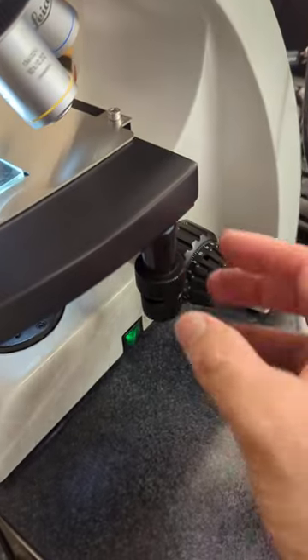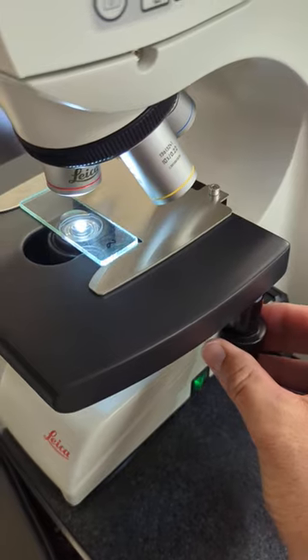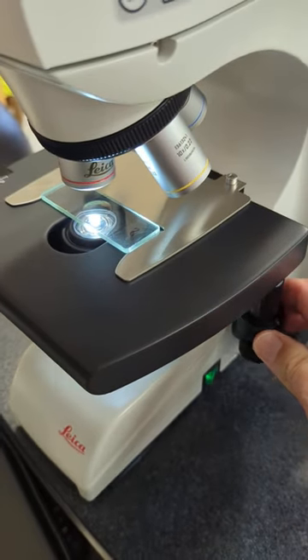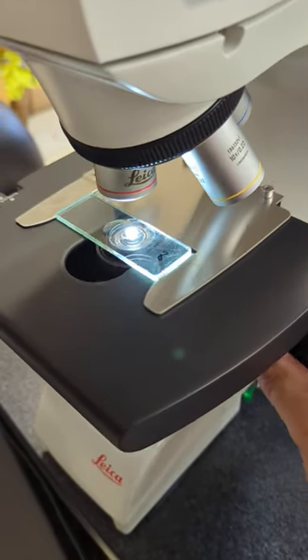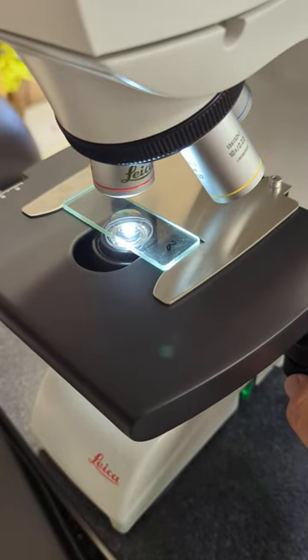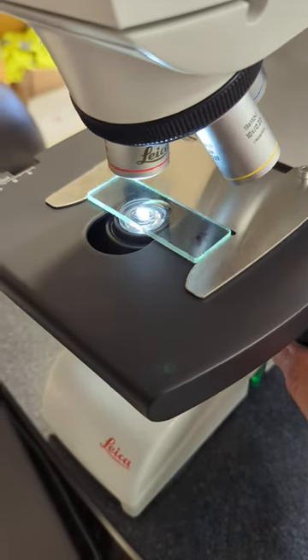You have your stage control on this side for X and Y. The top one moves it in the Y direction, front to back. The bottom one moves left to right in X.